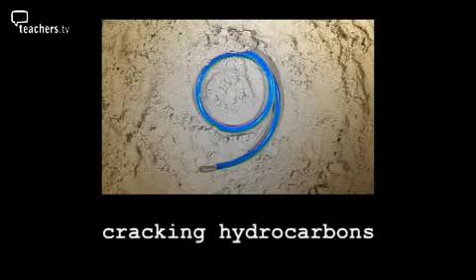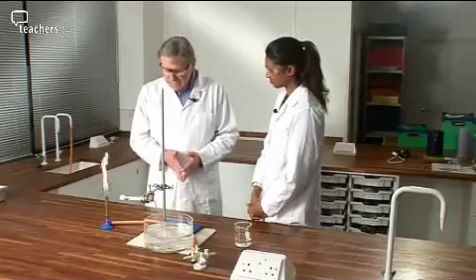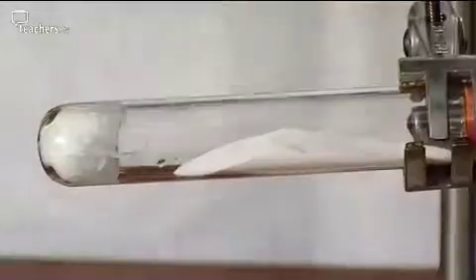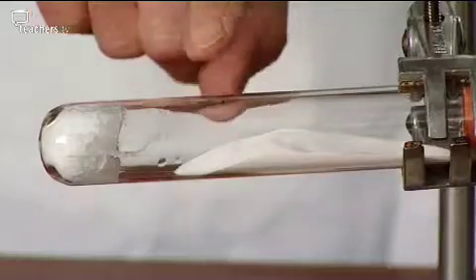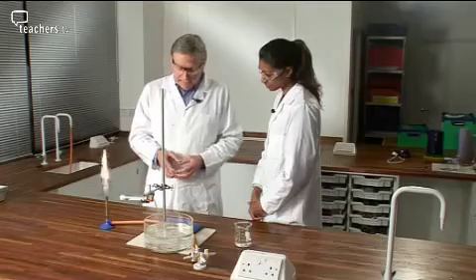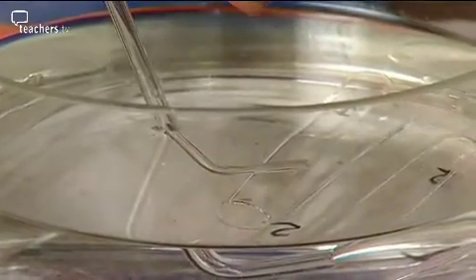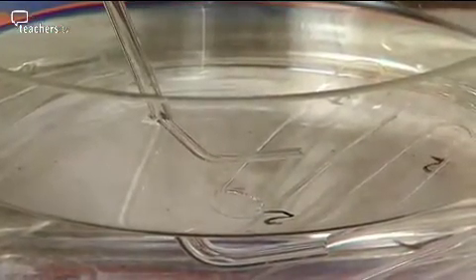And at number 9, a classic, cracking hydrocarbons. But watch out for suckback. So Colin, what do we have here? Well, this is an apparatus to basically break down a long-chain hydrocarbon into a smaller hydrocarbon. We have a boiling tube which contains some aluminium oxide, and at the end of it is some mineral wool soaked in liquid paraffin. At the far end we have a delivery tube running down into this trough which is filled with water, and inside the trough are test tubes also filled with water.